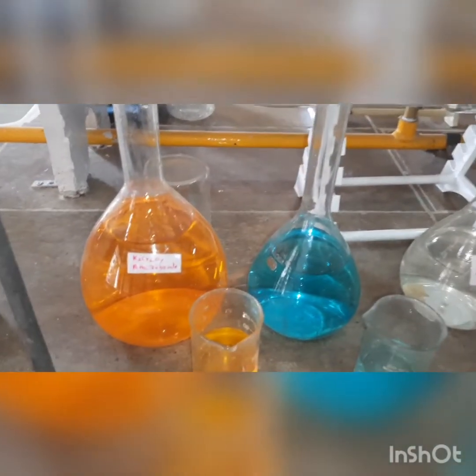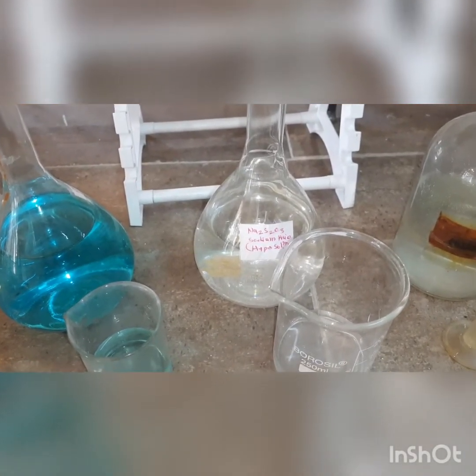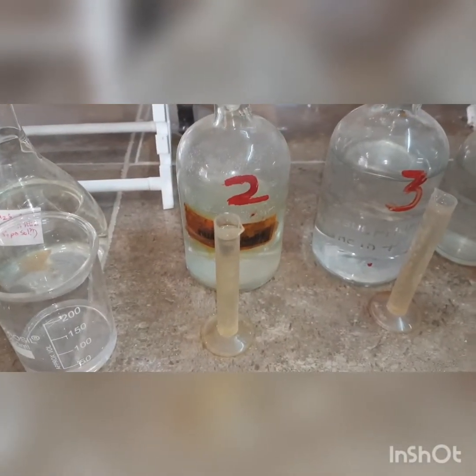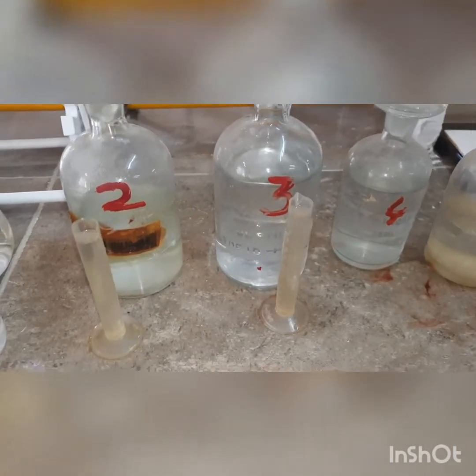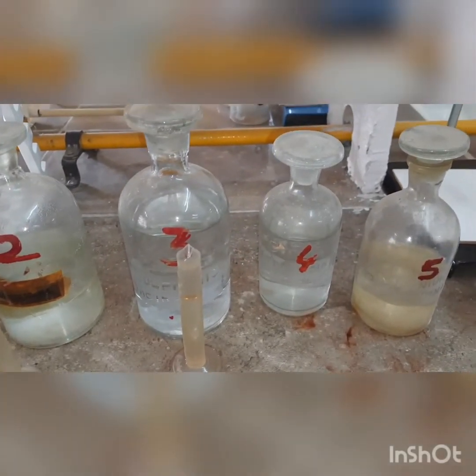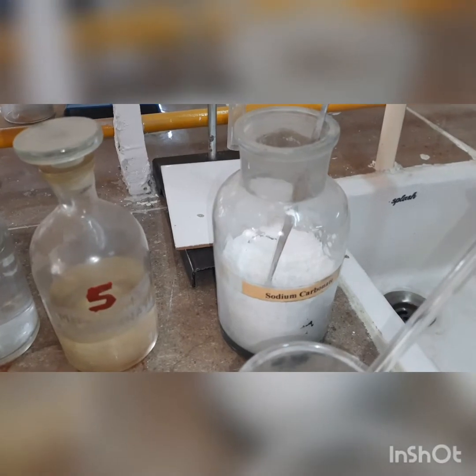For chemicals, we are going to use potassium dichromate — this is a standard potassium dichromate solution. We will use a copper sample in which the amount of copper needs to be estimated. We will require hypo, that is sodium thiosulfate — this needs to be standardized. We will use 10% KI solution, 10 ml of it, 10 ml of dilute sulfuric acid, glacial acetic acid, ammonium thiocyanate, sodium carbonate, and starch as indicator.